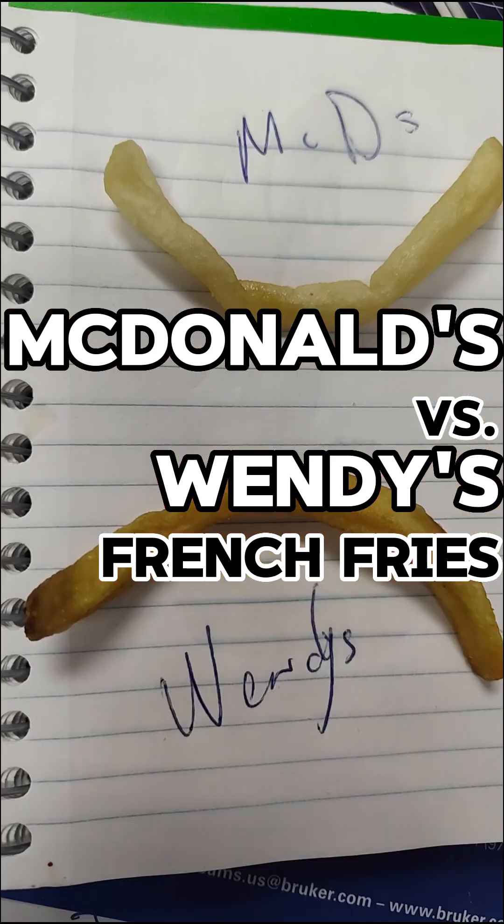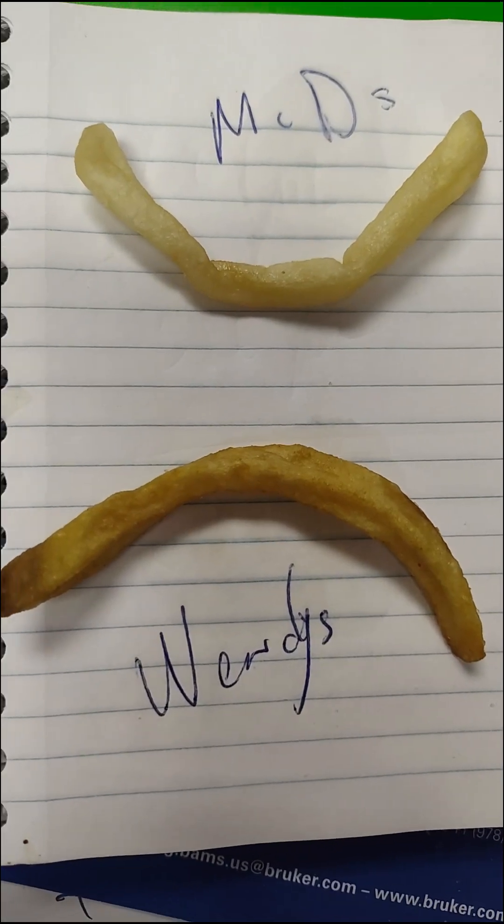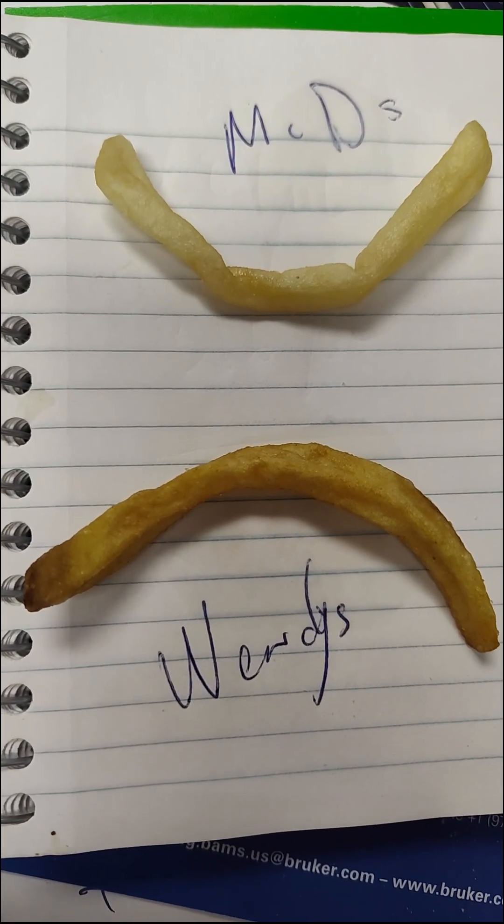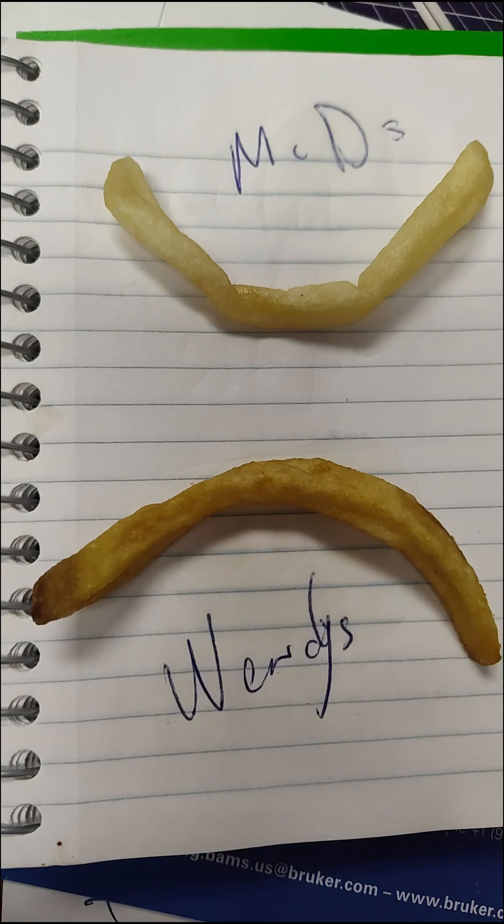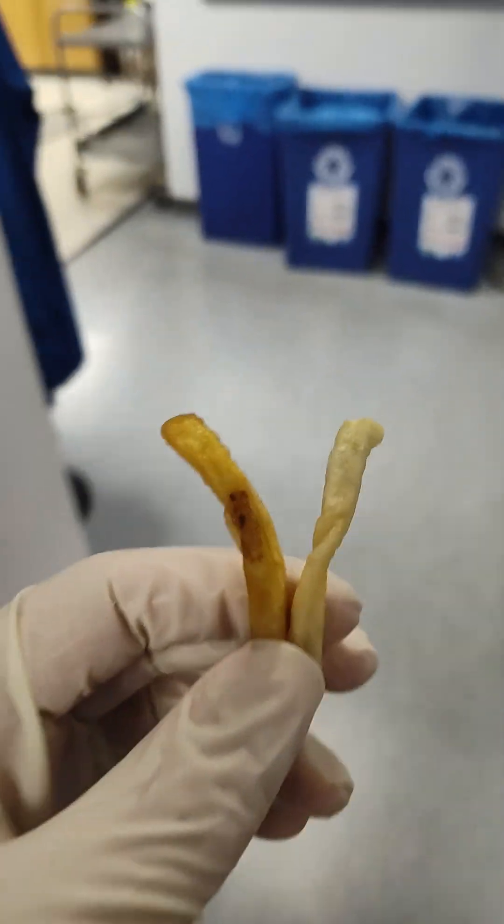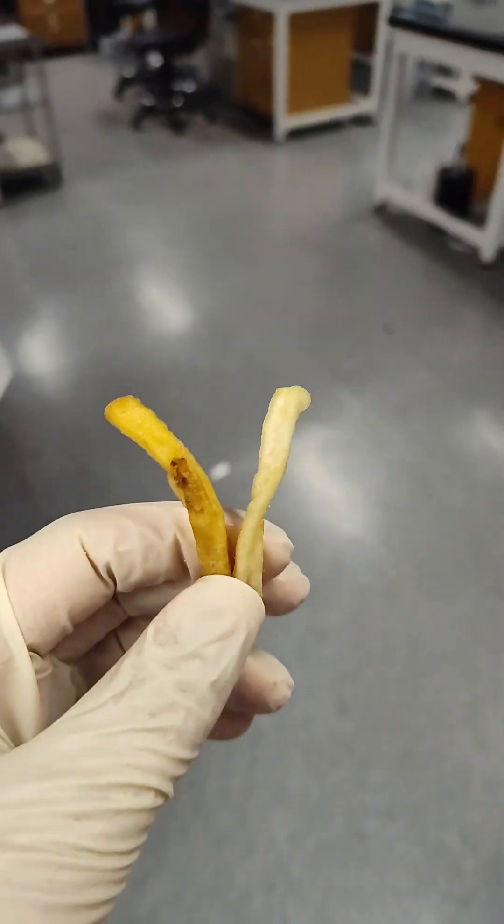French fry competition. Alright we got the Wendy's french fry and the Mickey D's french fry. I just chose one at random. I'm not going to blend a bunch together. So we're just going to do like the end tip of the french fry. Pretty obvious.